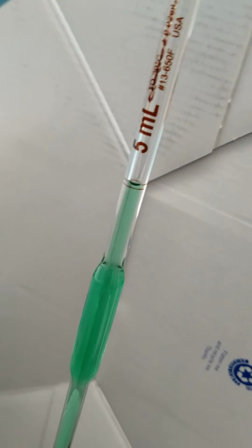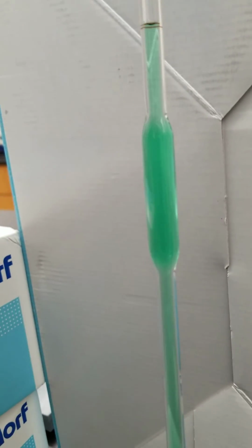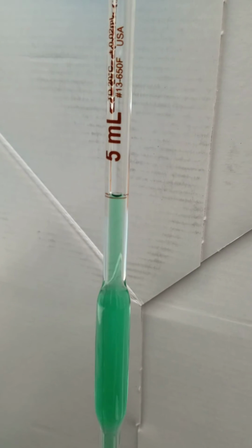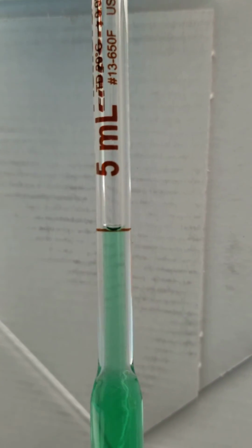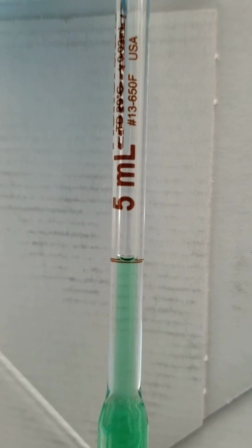If I looked at it above, it looks falsely high. If I look at it from below, it's falsely low, okay? And looking at it straight on, that's why we have to do it that way, okay? So there's your meniscus right on the line at the bottom. Now I'm gonna let it go.